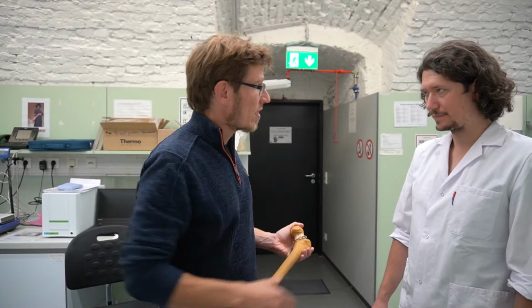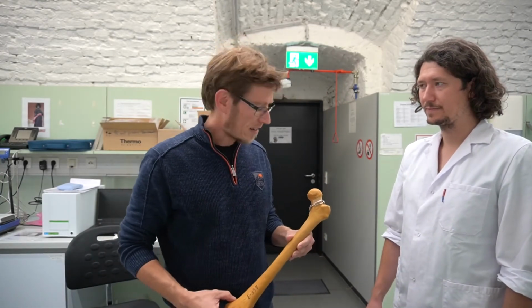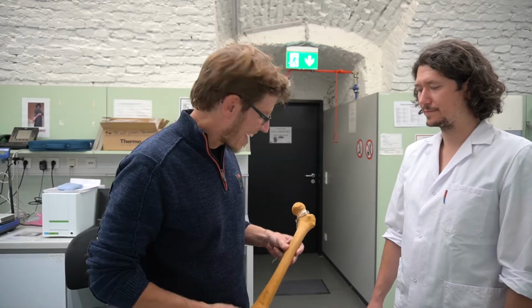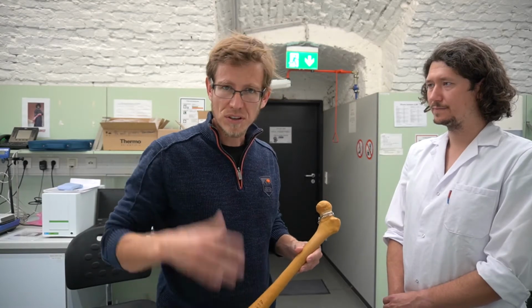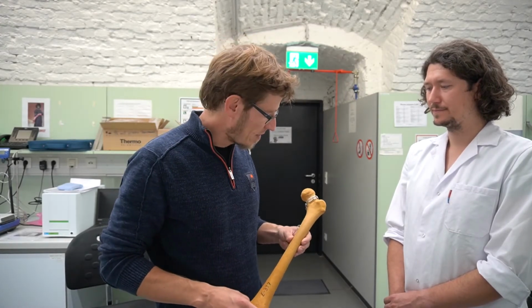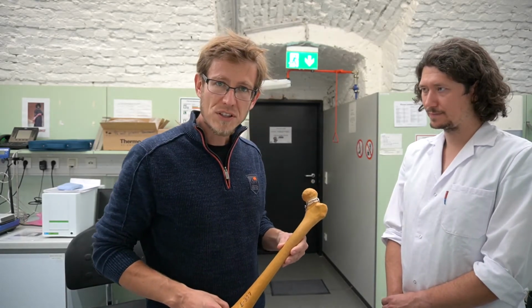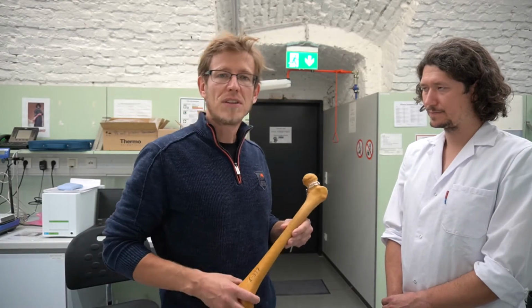In a previous project we focused on the inside of these joint regions. We investigated the properties of single trabeculae, depending on whether they are healthy or osteoporotic. And in this project right now, where we show you what is going on in a few minutes, we are focusing on cortical bone. That means we are cutting out tiny specimens of the cortical region in order to test them mechanically and to extract material properties.